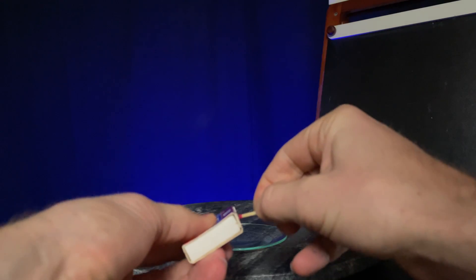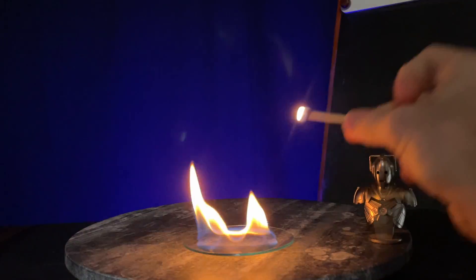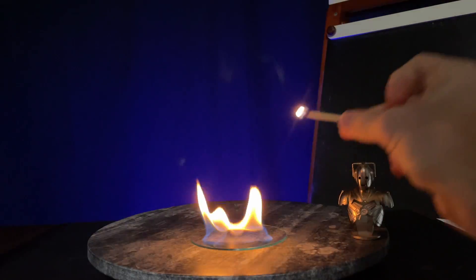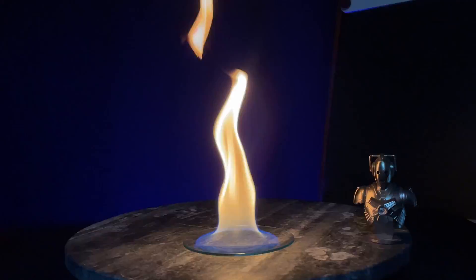The smaller spray alcohol particles bump into oxygen atoms easier than the alcohols below the surface of the watch glass. After blowing out the alcohol, I'll immediately relight. Watch how the alcohol lights this time — it's pretty surprising. What's the difference between the initial light and this one? Temperature. This alcohol is quite hot and produces much more vapor. The vapor is what ignites.